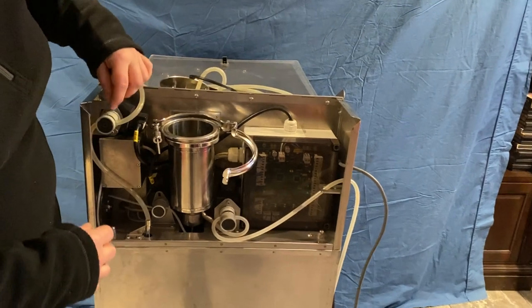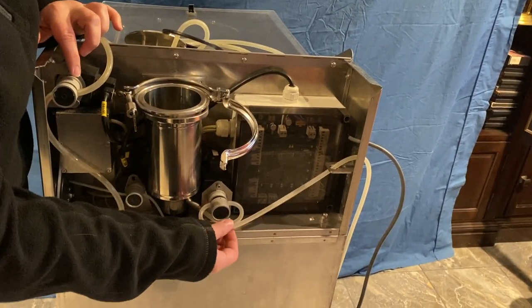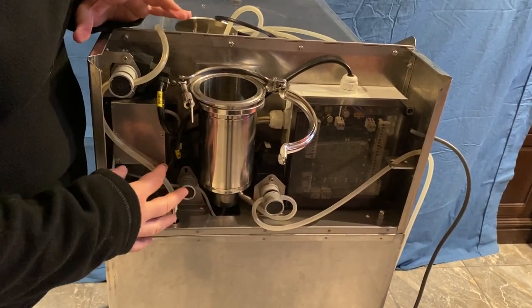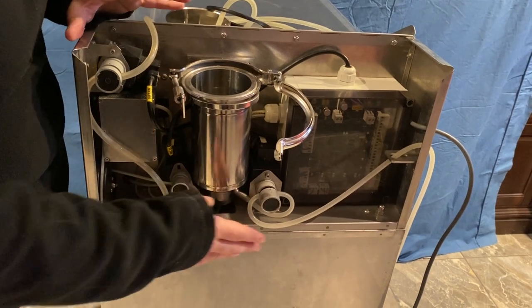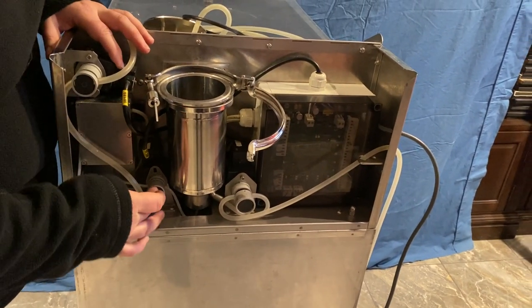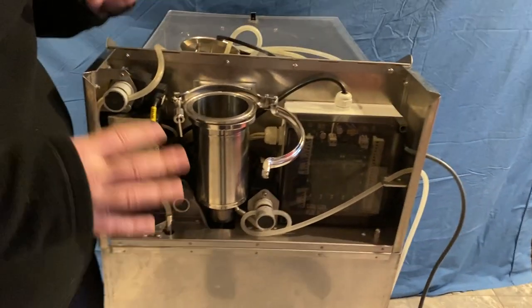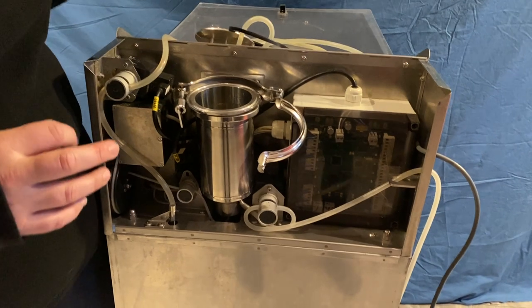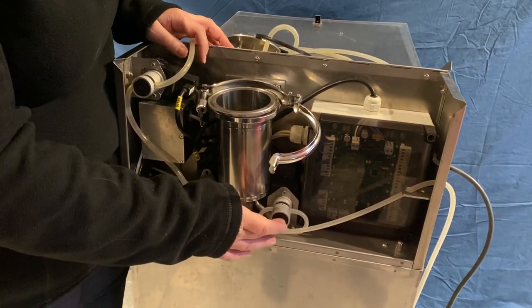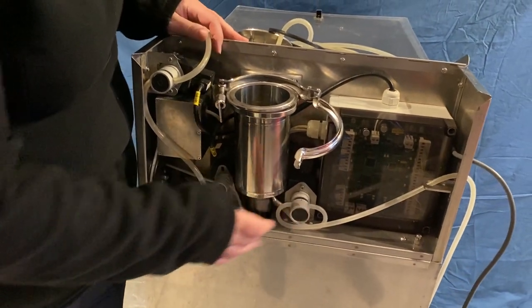Notice the various pinch valves that the milk lines sit in — these control where air can flow and which lines are active at any given time. I recommend pushing all of them as soon as you start working back here, just to make sure they are free and moving properly. In wintertime particularly, moisture can get into them, cause them to freeze, and prevent them from working.